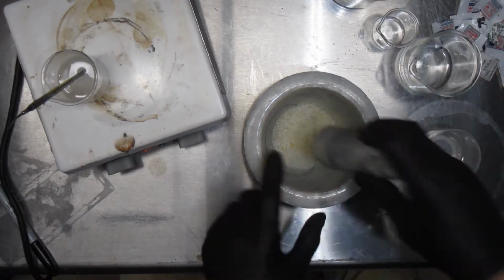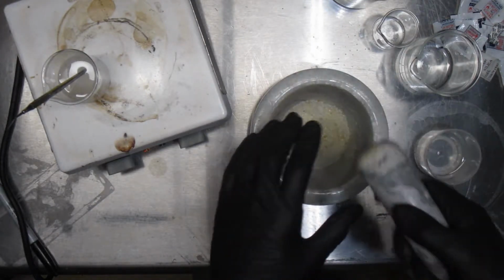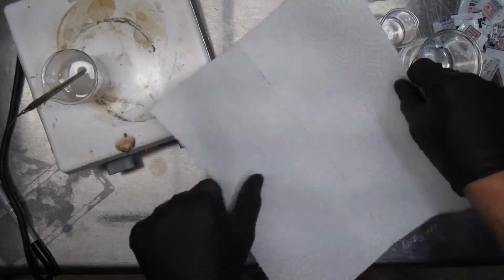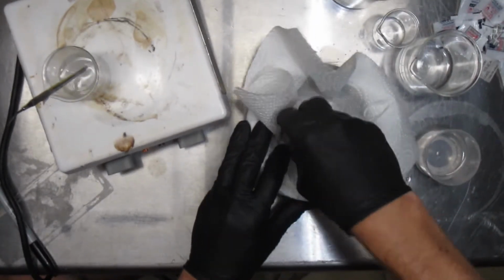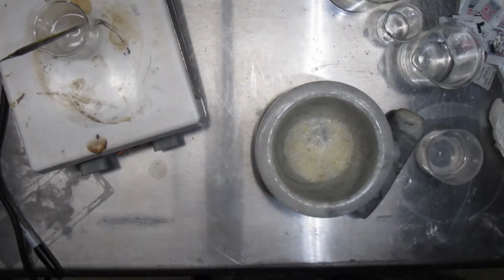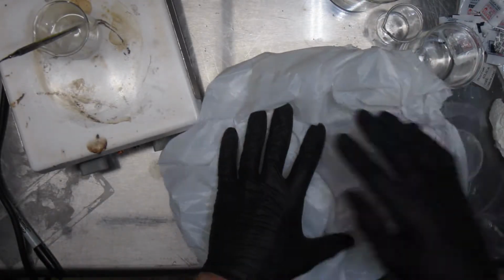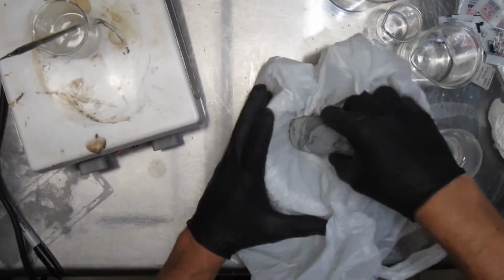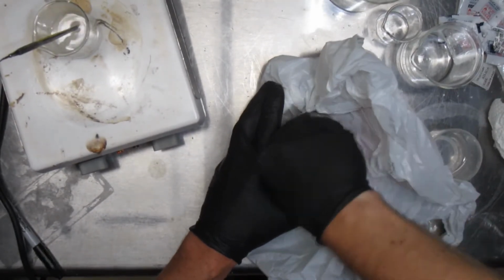All right, now silicone, this silica gel. Oh, actually, we might have a little bit of a problem here. I'm going to need something to cover this with. My balls will be popping out everywhere. So embarrassing. No. Okay, still need something in there. Hang on. See, I knew I'd find a use for these bags. Okay, no go anywhere. I might have to reweigh this out afterwards.